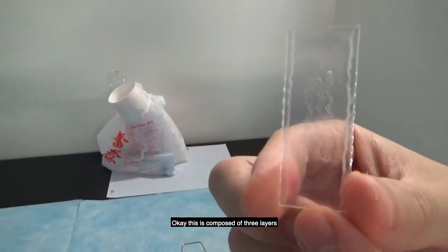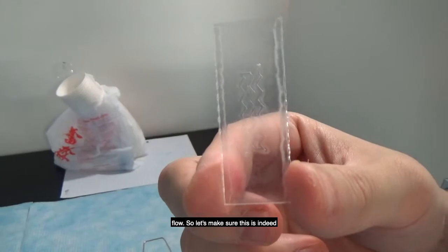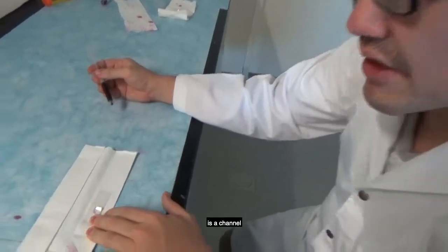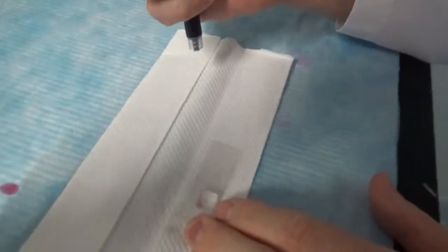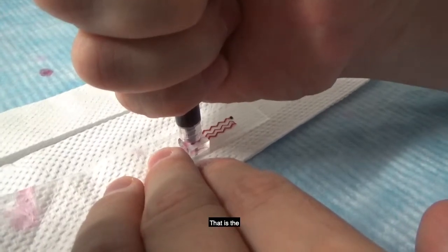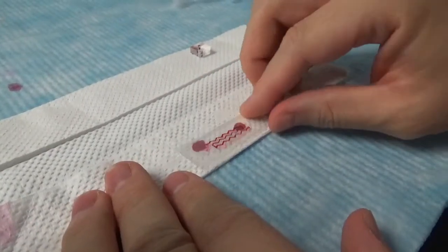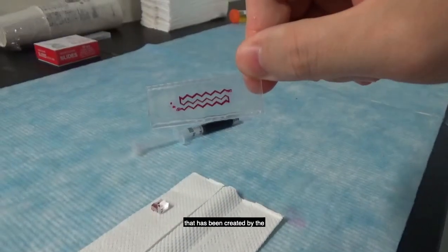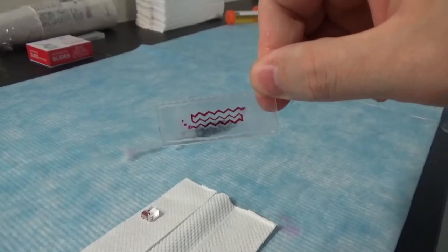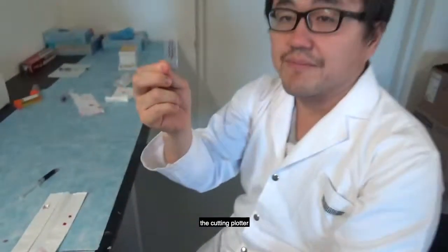This is composed of three layers, and the middle layer is providing the space for the fluid to flow. So let's make sure this is indeed a channel. We want to show this is indeed a channel, right? So we place the PDMS to interface this syringe to the microchannel, and then if you place fluid, yes. So if you clean up, this is in fact a microchannel that's been created by the cutting plotter. Okay, so this concludes the fabrication of the microchannel using the cutting plotter.